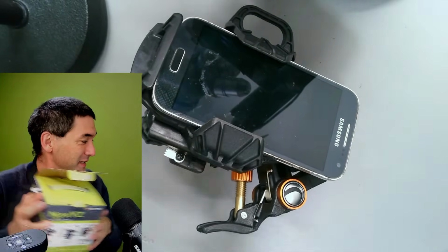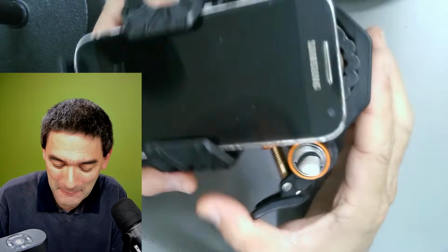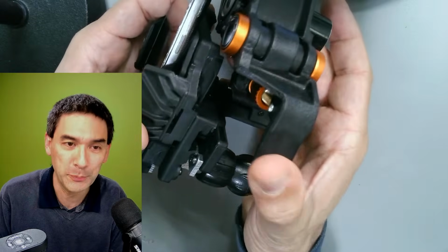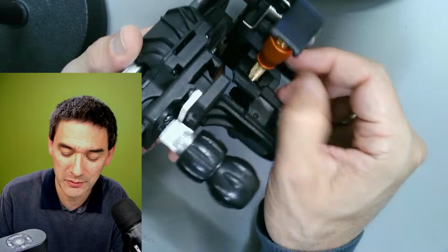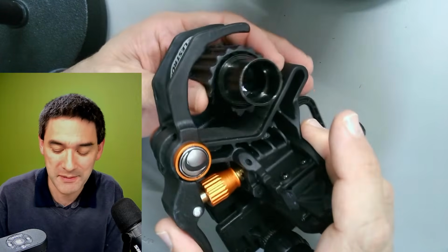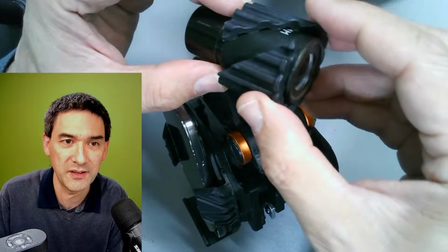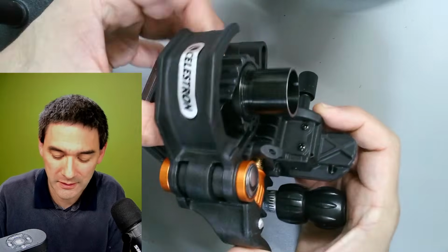And this one is truly over-engineered. How does this work? Essentially, you can clamp this one by pushing this lever here. Now you cannot push it, because there's a screw here that you have to untighten, and then you can push it and release the eyepiece. It also comes with those plastic collars to adjust the width, and then you clamp it in like this.